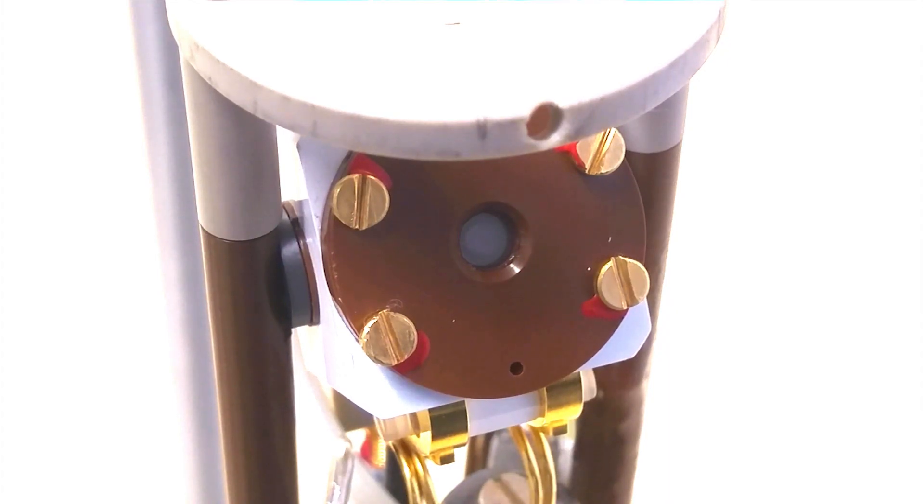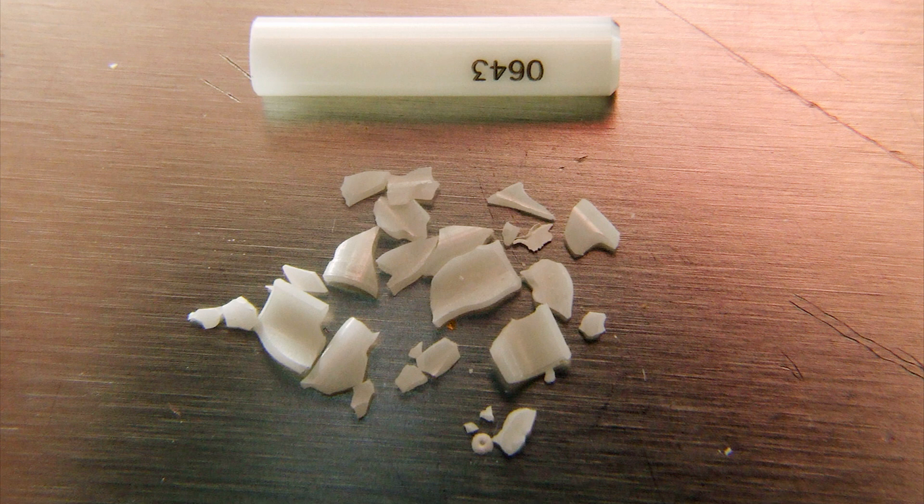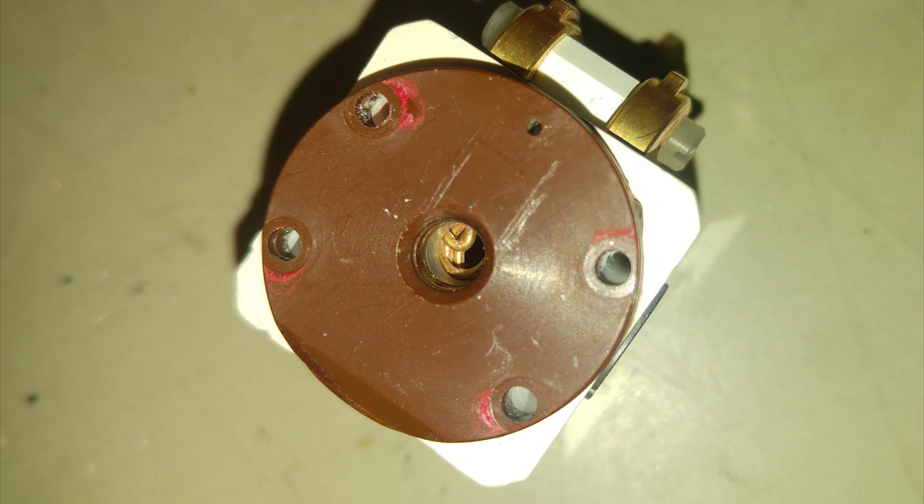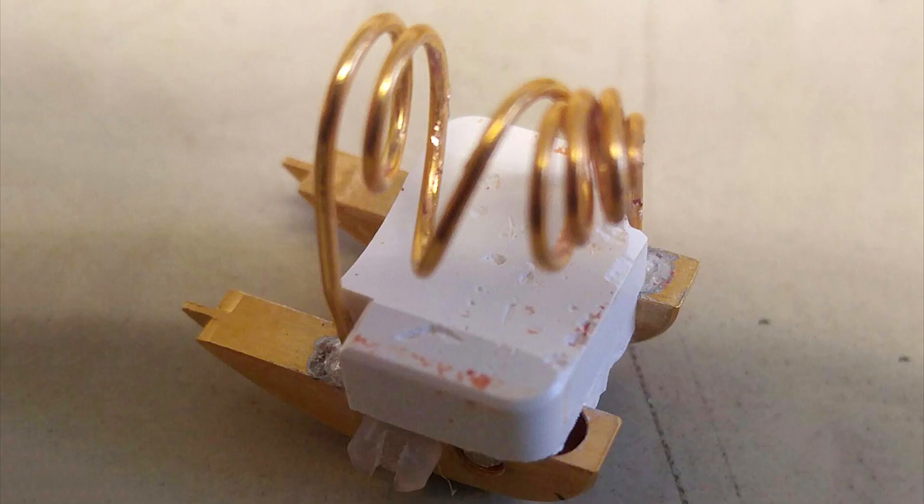In the case of a solid-state probe, the sample is placed in a rotor and spun many thousands of times a second. Occasionally, the rotor explodes, trashing the probe head. This happened to us recently.